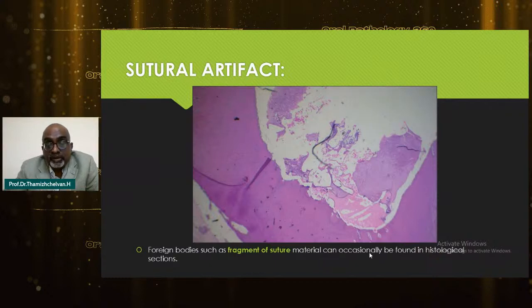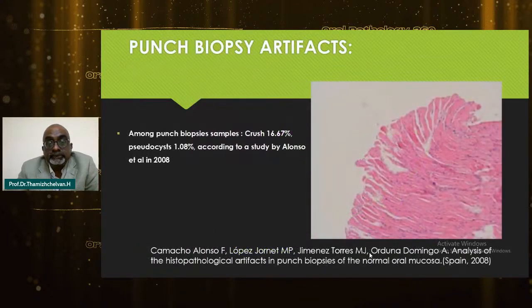Improper suture removal can also be considered a foreign body, and it can be histologically found in some sections. Punch biopsy artifacts are also common, according to a study by Alonso et al. in 2008, who said that because of punch biopsy, 16% have crush and pseudocysts, because of excessive heat. It's very common here.